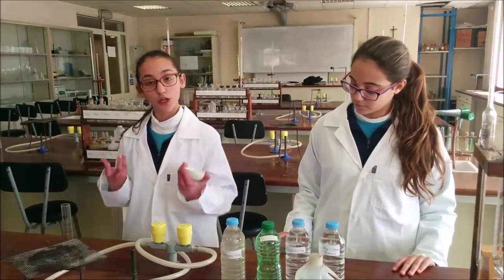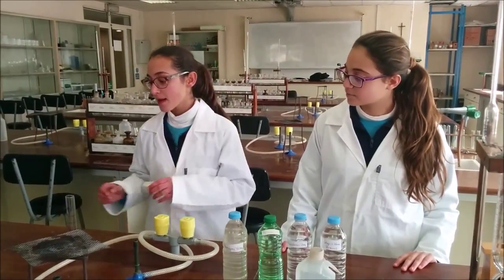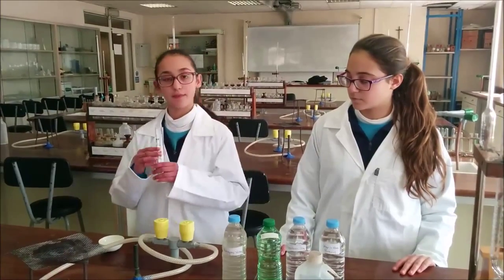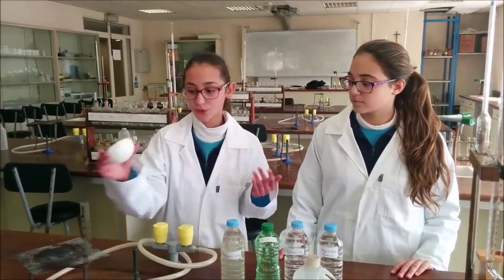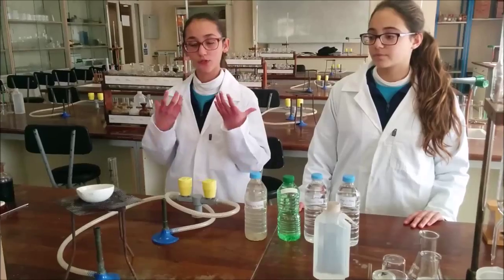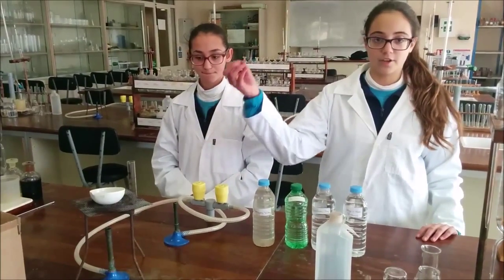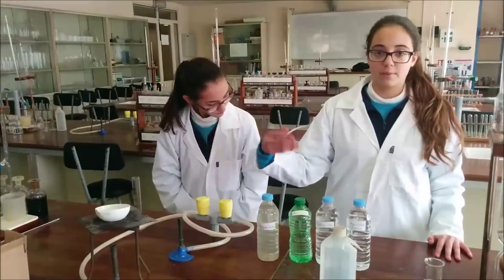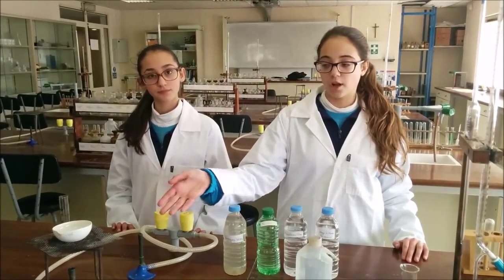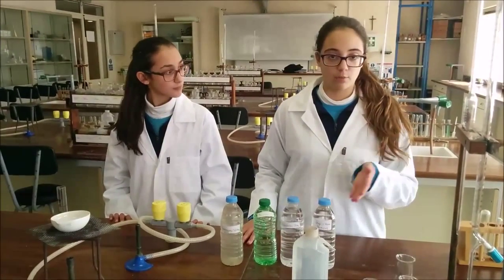First, to find the total dissolved solids in these samples, we're going to weigh this evaporating basin and pour the sample in the measuring cylinder and transfer it to the evaporating basin. After that, we're going to put it on the tripod stand and heat it. After heating occurs, water vapor rises, then we switch off the Bunsen burner. We will find its mass and then divide the dissolved solids by the volume of the water evaporated.